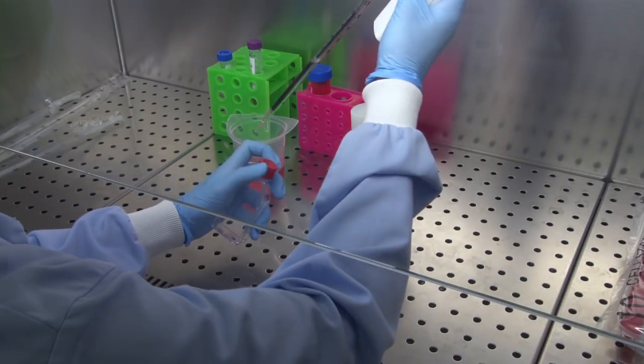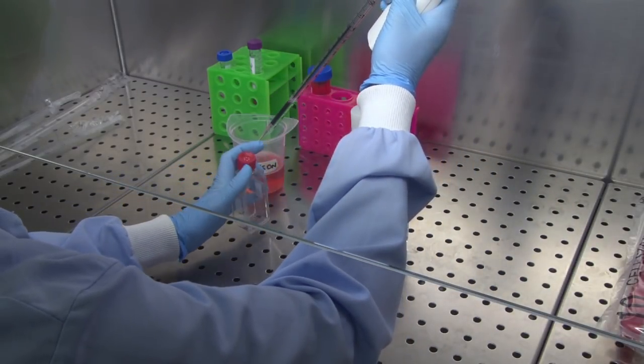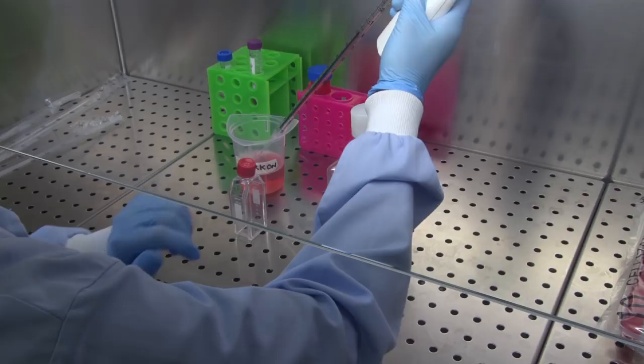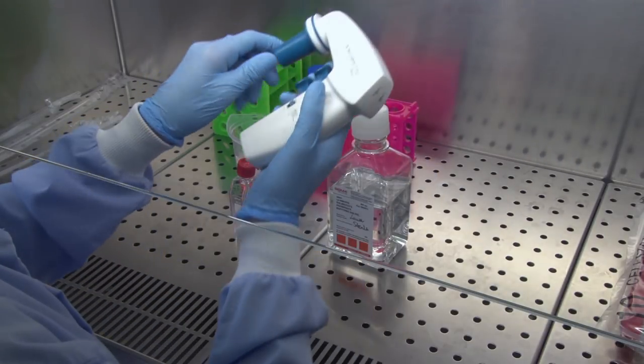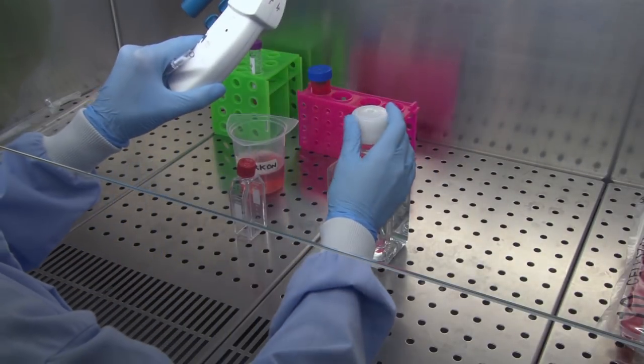For health and safety reasons, and to prevent any release of biological material into the environment, all biological material must be disposed of in disinfectant.